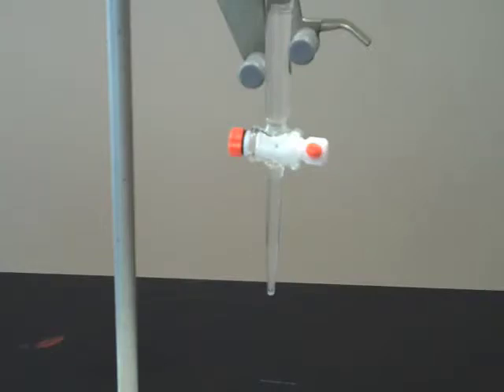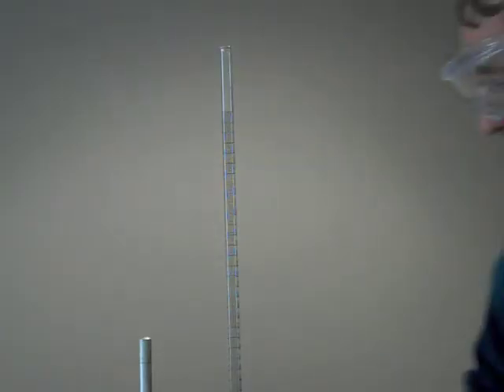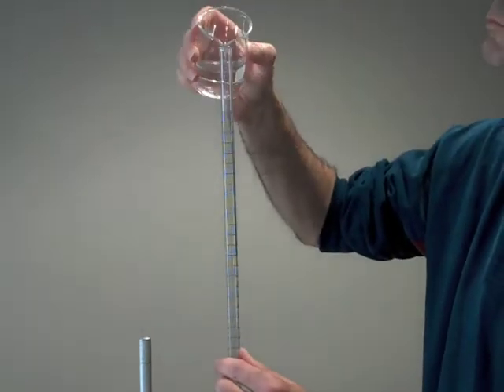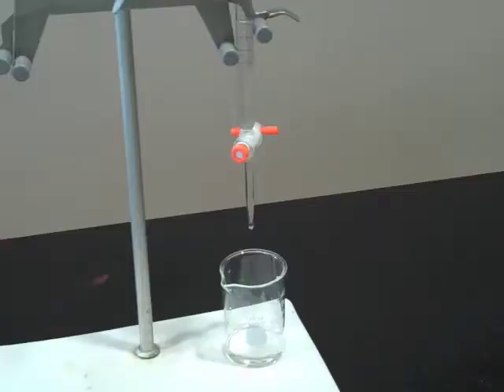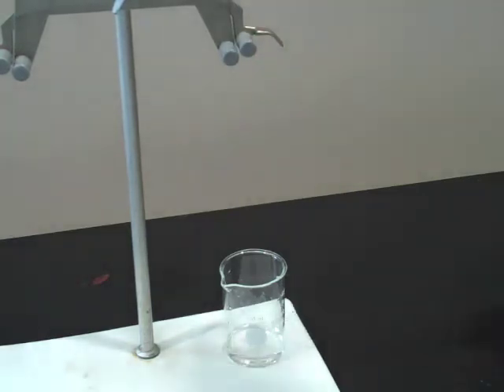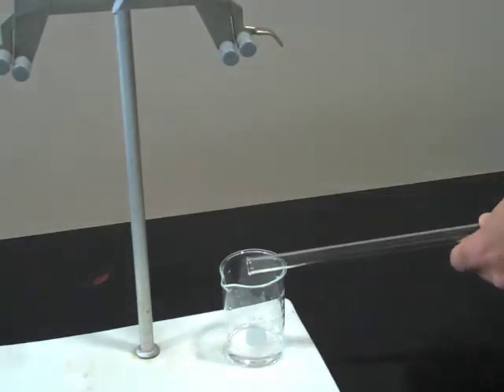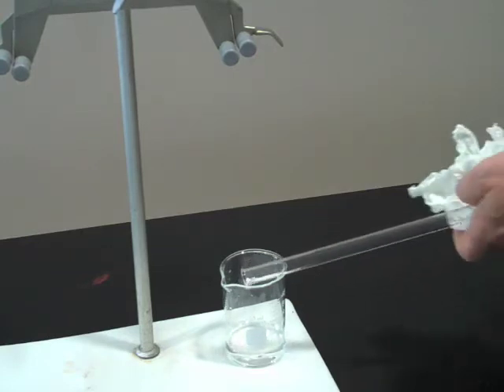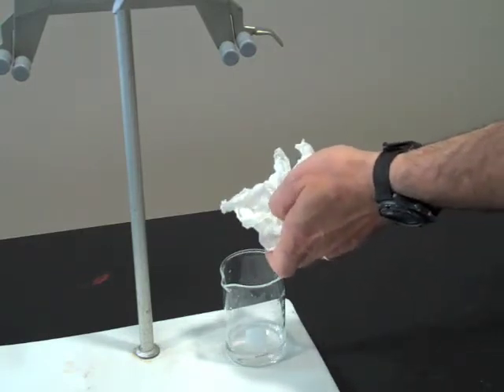Be sure that the stopcock is closed and then pour the titrant solution slowly into the open end. Rinse the burette with 5 to 10 milliliter portions two or three more times. Rotate the burette slowly as you pour the liquid out into a waste beaker.